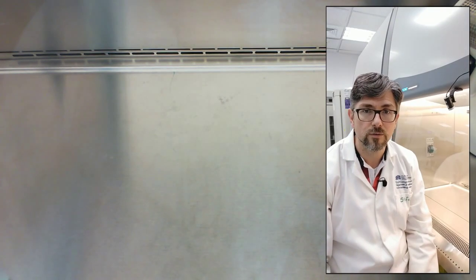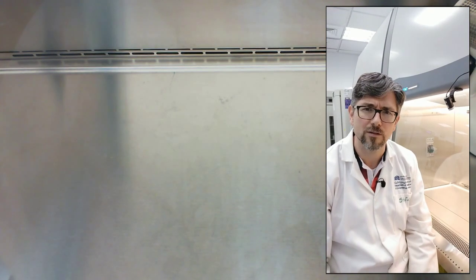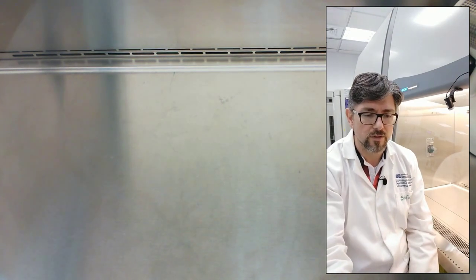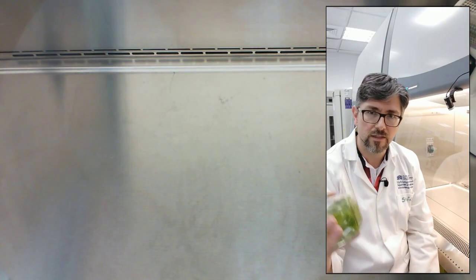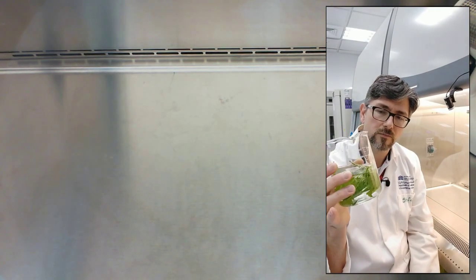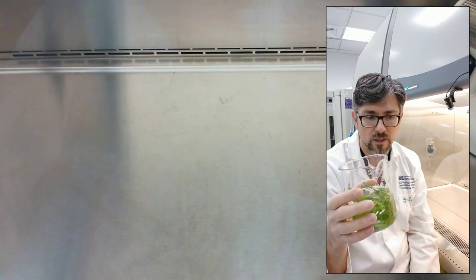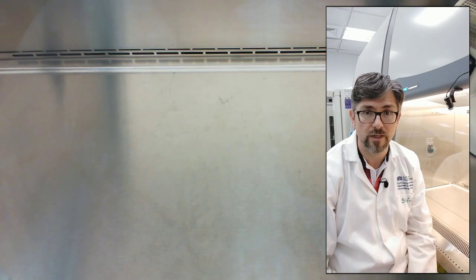Hi everyone, in this video we're going to try to generate plant calluses. What I have here is a beaker currently containing my plant parts that I'll be using as explants, and it is incubating in some bleach, 15% Clorox. It's been there for about 10 minutes, so it's almost ready to come out. I'm just going to prepare my work area and get started with this.